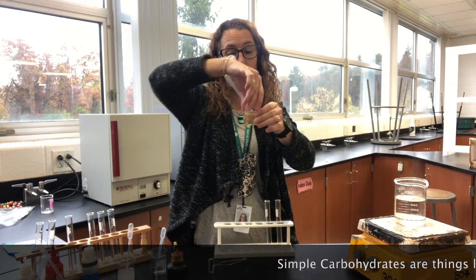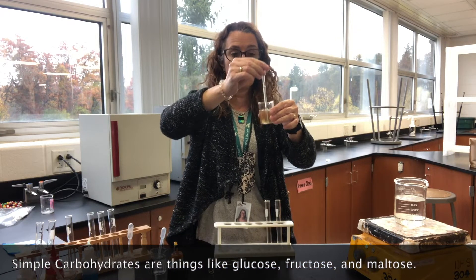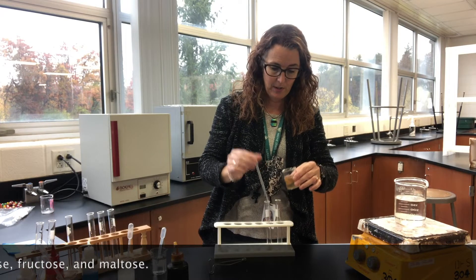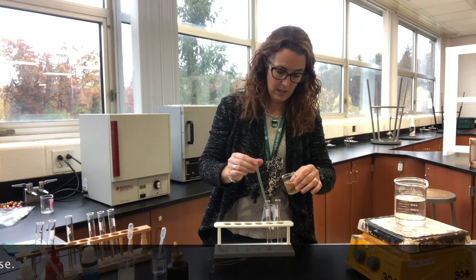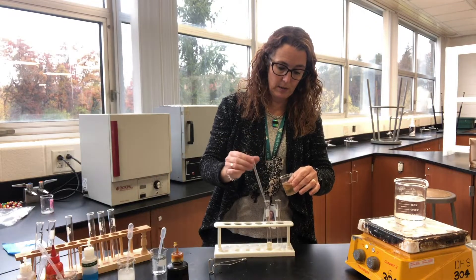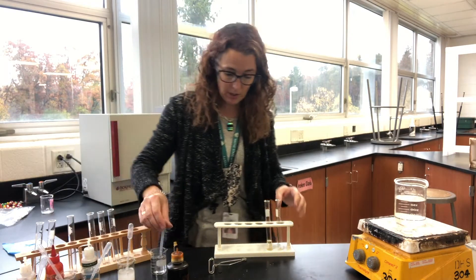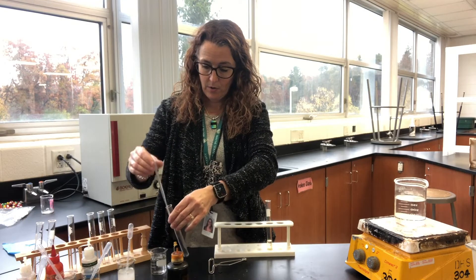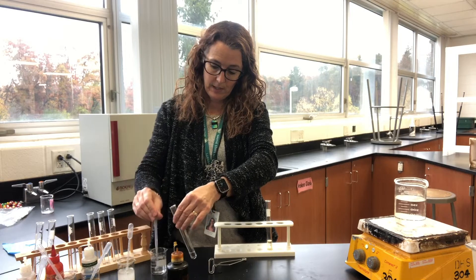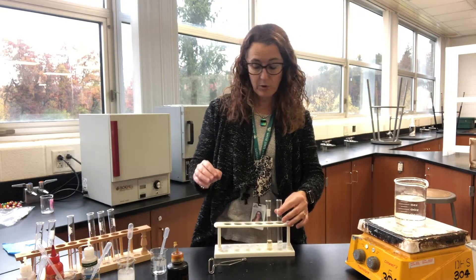Our next test is going to be for a simple sugar. We're going to use maltose and I'm going to put a few squeezes of maltose into my test tube. Then in my control I'm going to put water, just like we did before.